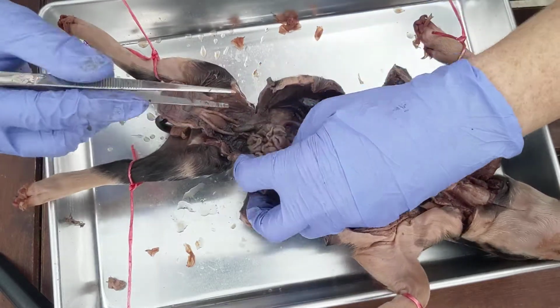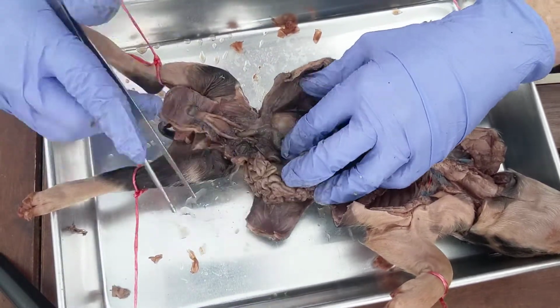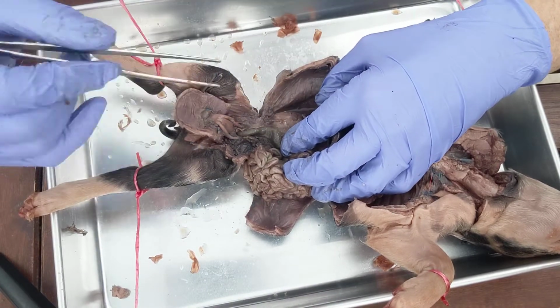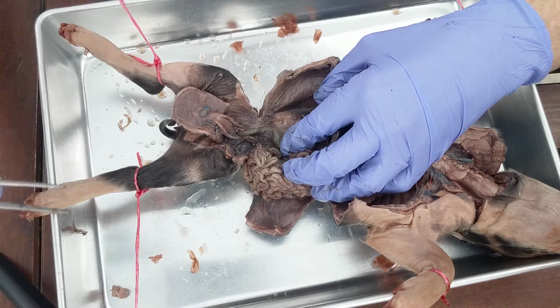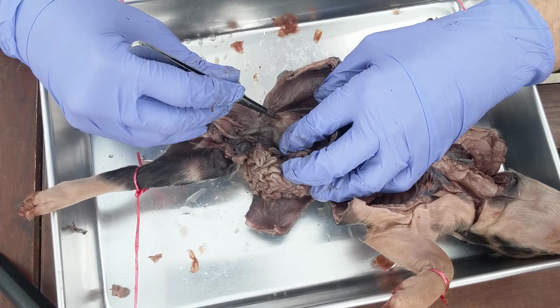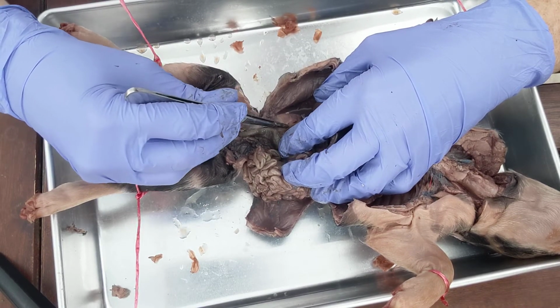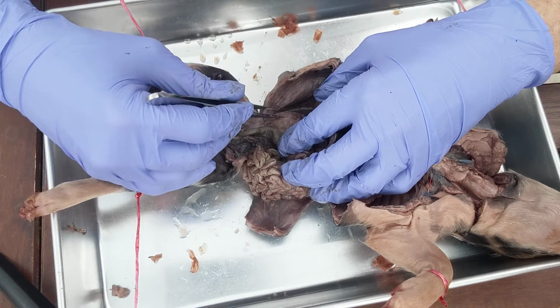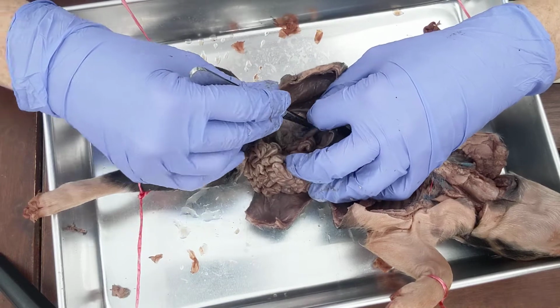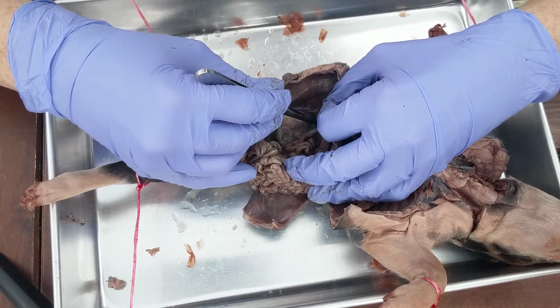Okay, let's look at kidneys. So if we take all the intestines and we push them off to the side, see this structure right here? That's the kidney. Now the kidney is what we call retroperitoneal. Retro meaning behind, peritoneal as in the peritoneum, the parietal peritoneum. So it's behind the membrane that lines the abdominal pelvic cavity wall. So if you break through that, there's usually quite some fat in here too, maybe. This right here would be the kidney.